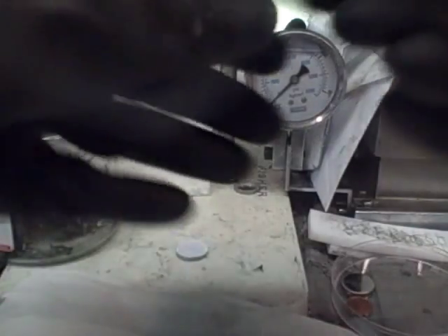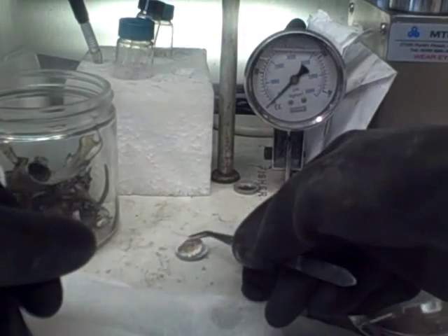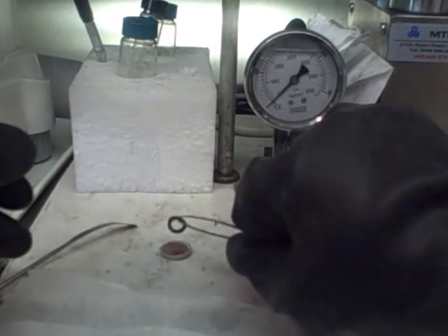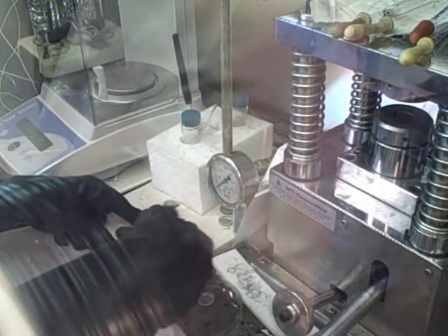Lithium is now added to act as a counter-electrode. In a typical cell, a cathode will be placed here, but since we are investigating anode materials, the lithium metal provides a consistent counter-electrode. A highly conductive copper plate is added to fill the remaining void, and a spring to ensure even contact. Finally, the cell lid is placed and the cell can now be sealed.